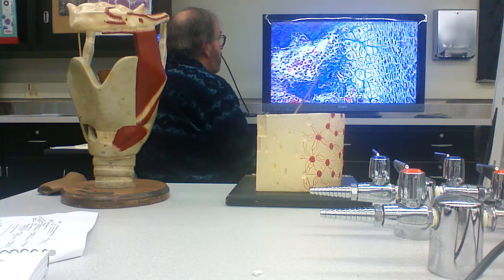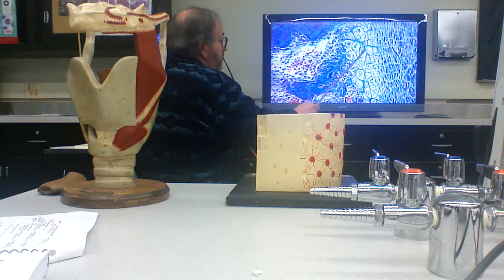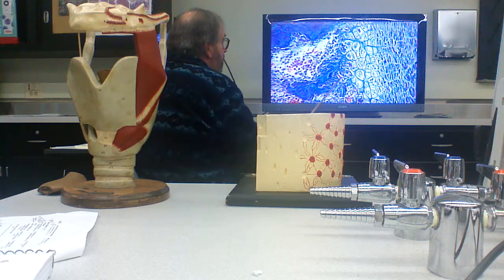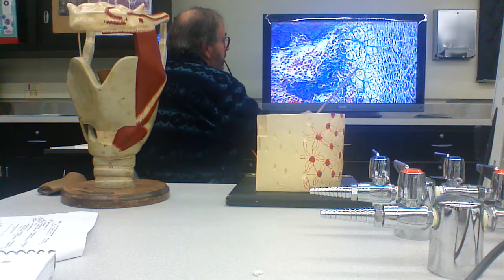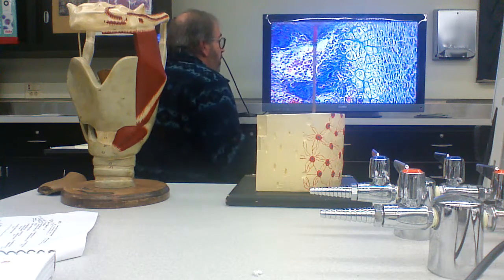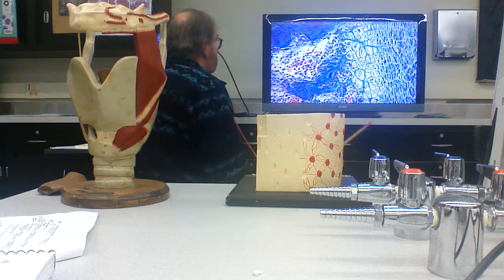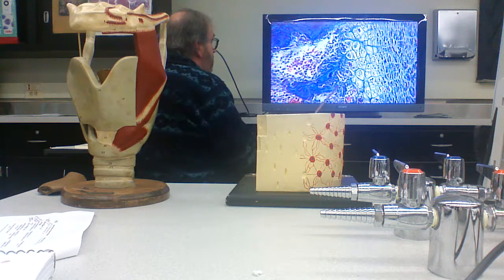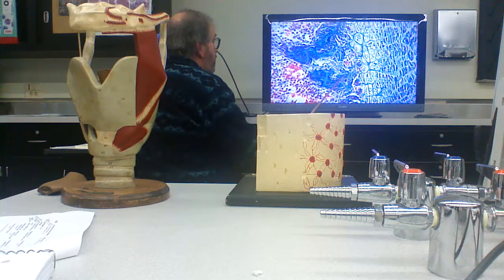And this part here, in the zone of calcification, they're building bone matrix on top of the framework of those cartilage cells. And so you basically start to calcify.